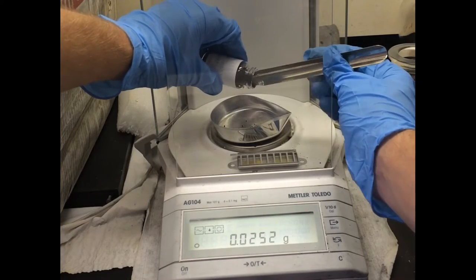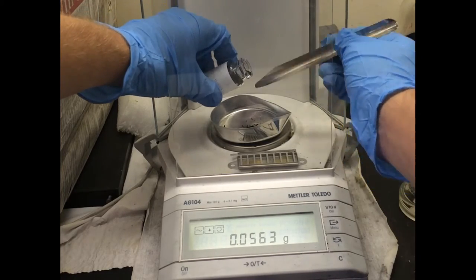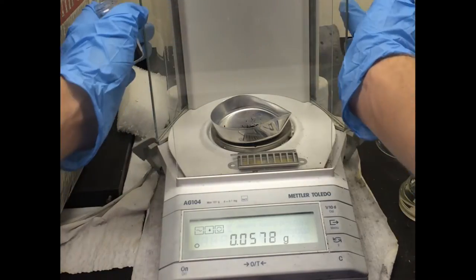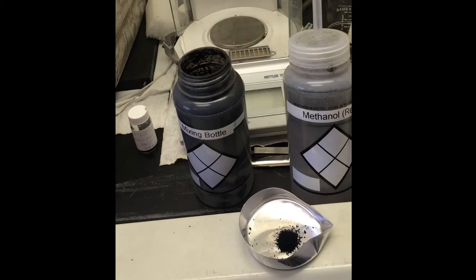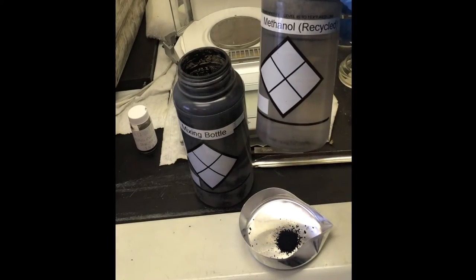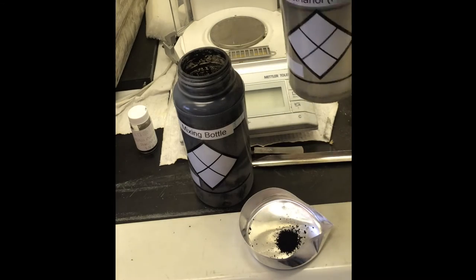Since the powder itself is an adsorption material, the mass shown on the scale includes impurities such as water, which will be desorbed later in an oven.